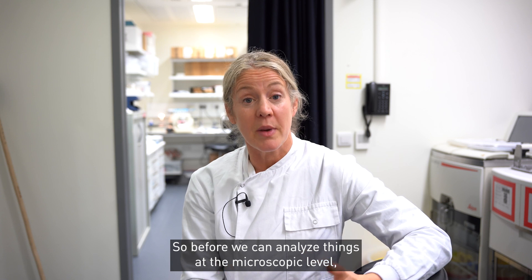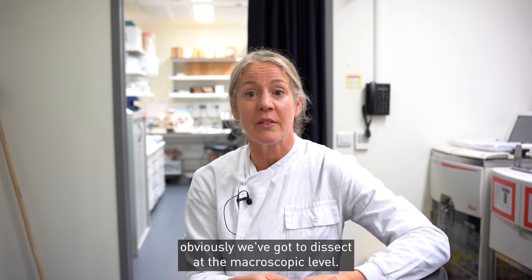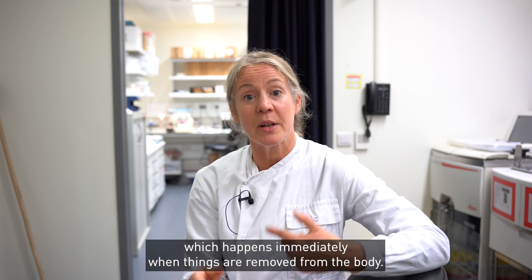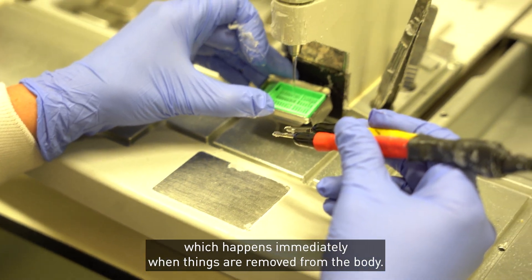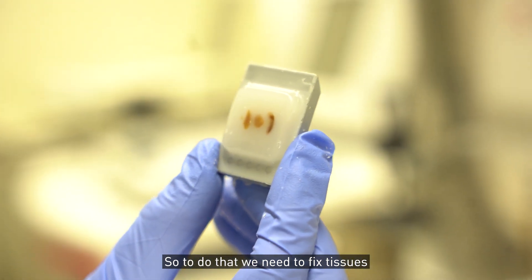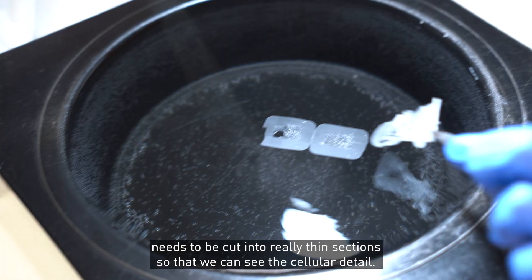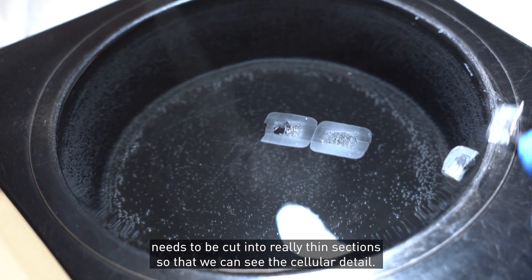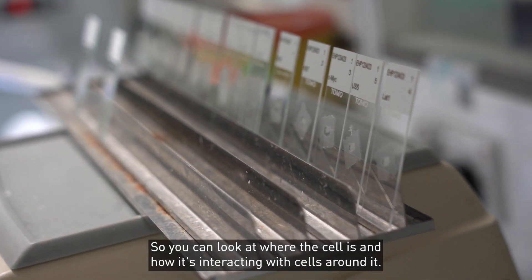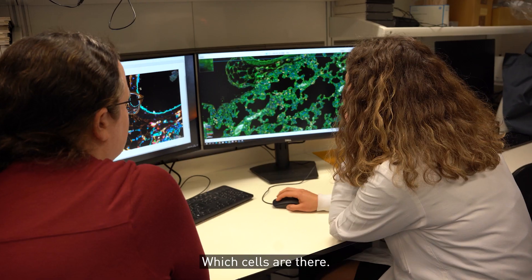Before we can analyse things at the microscopic level, we've got to dissect at the macroscopic level, and we have to stop the process of decay which happens immediately when things are removed from the body. To do that we need to fix tissues and keep them in as lifelike a state as possible. Fixed tissue then needs to be cut into really thin sections so that we can see the cellular detail — where the cell is, how it's interacting with cells around it, and which cells are there.